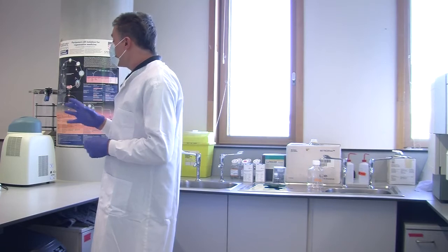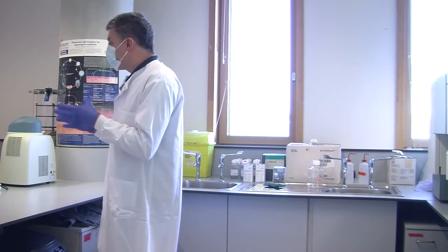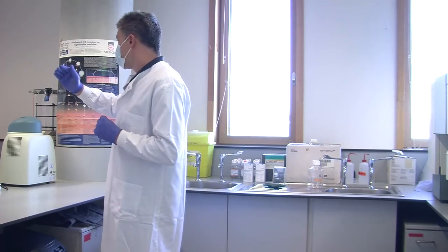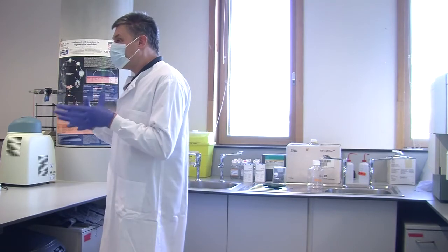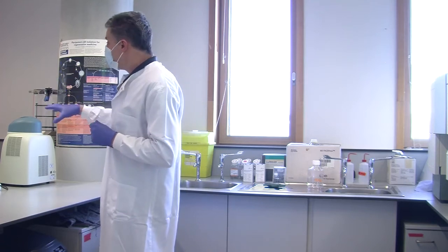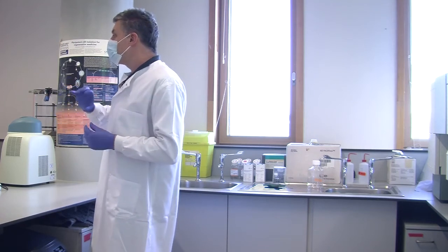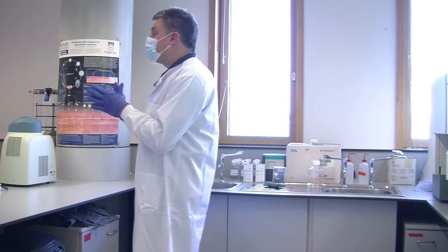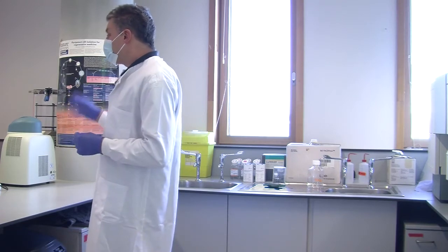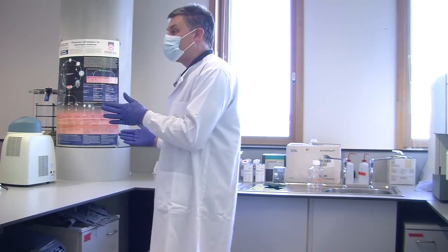Well, there's lots of ways. Sometimes it's availability. If you want a particular antibody, say CD4 for human T cells, helper T cells, and you open a catalogue and look down the list, you will see 100 different fluorochromes, because CD4 is very commonly worked on in a whole load of different fields, so people want choices. Some of these other markers are more difficult because not many people work on them, so there's far less demand. You're not generally doing lots of different experiments, you're doing one sort of experiment with it. So sometimes availability, it could be that one of your markers only comes in one antibody.